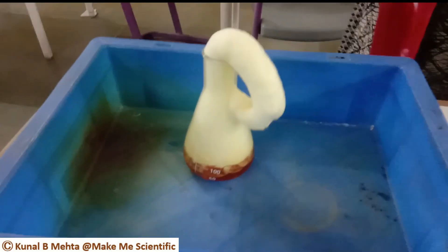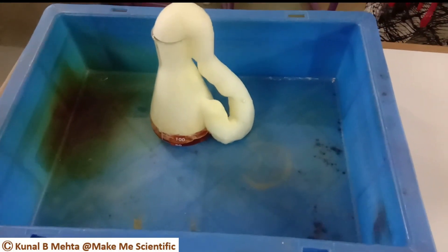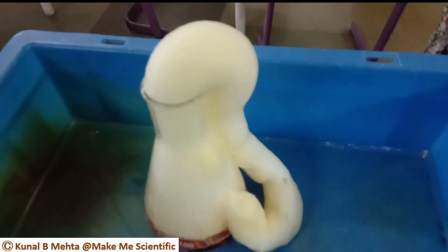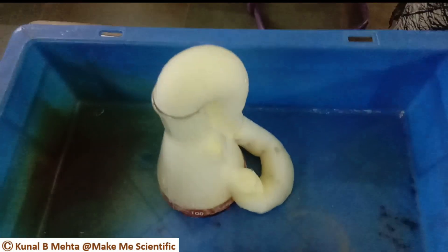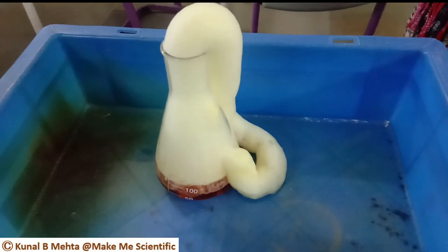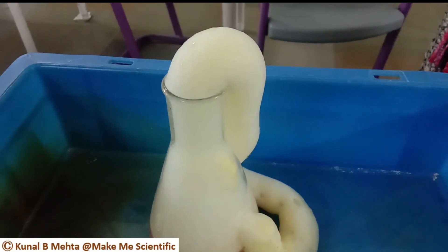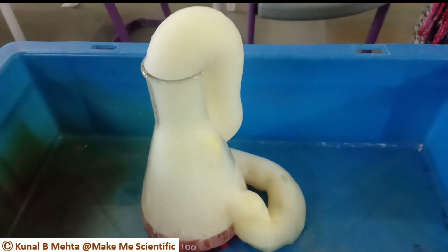That's an amazing view! Hydrogen peroxide breaks down into oxygen and water. As a small amount of hydrogen peroxide generates a large volume of oxygen, the oxygen quickly pushes out of the container and the soapy water turns into foam. I have added food color to dramatize the effect.